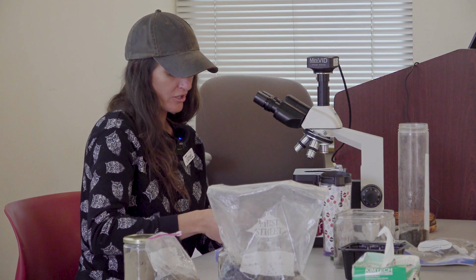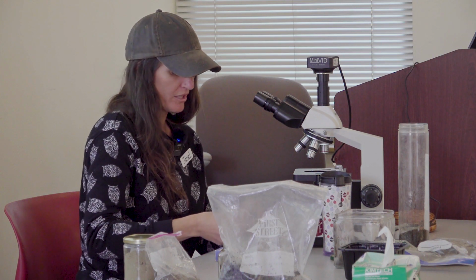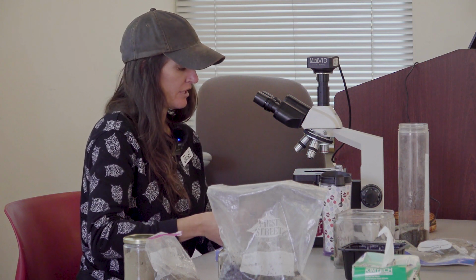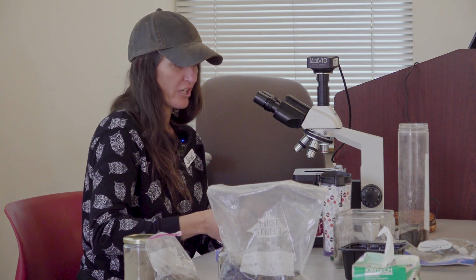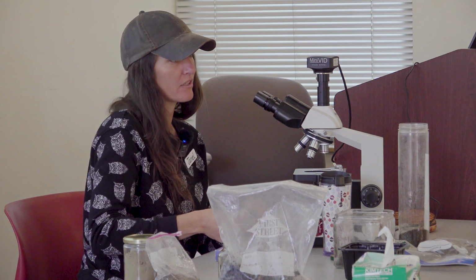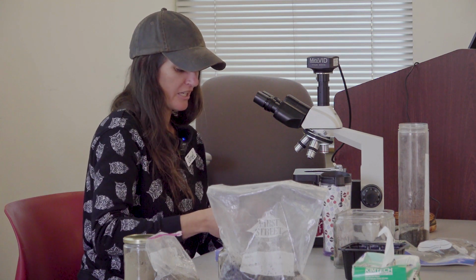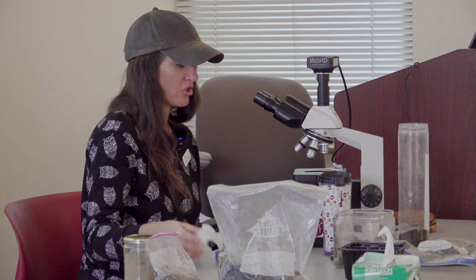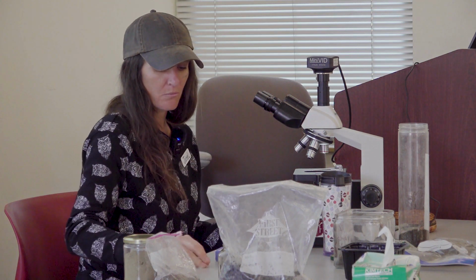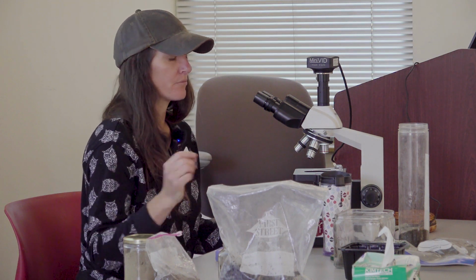Yeah, so microscopes actually are a pretty accessible way to be able to track the health of your own compost. This particular microscope is, in all reality, quite a fancy version. But we knew it was going to be used for educational purposes, so having some slightly nicer equipment can be a good thing. Most of the cost of this microscope is in the camera. High quality cameras and software can be very expensive for microscopes. You can get much cheaper versions. Probably somewhere in the realm of $200 to $300, you can get a perfectly acceptable microscope that you could use yourself for viewing samples.